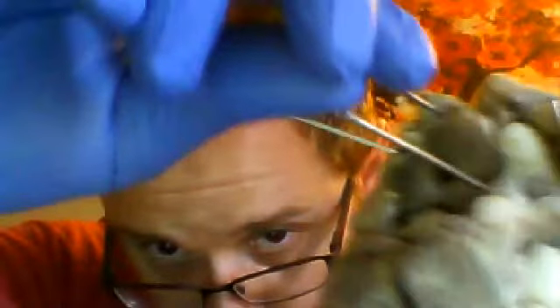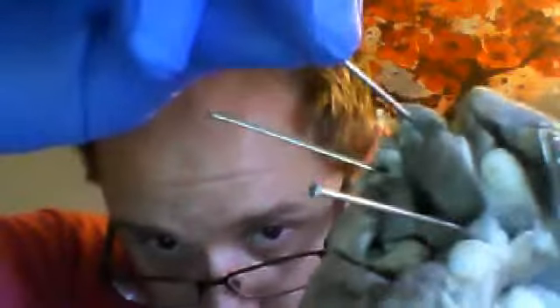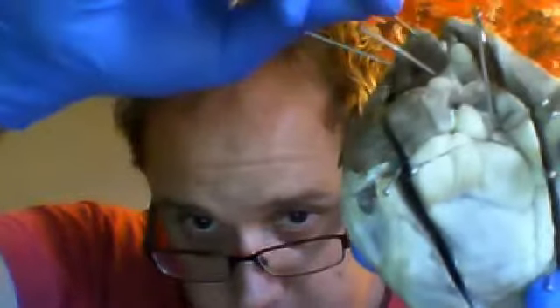You have the brachiocephalic artery, which we are fortunate enough to have, and that's this artery right here. Let's give you a little bit better of a view. That artery right there. And then you also have the left common carotid and the left subclavian arteries. Those aren't featured on here.